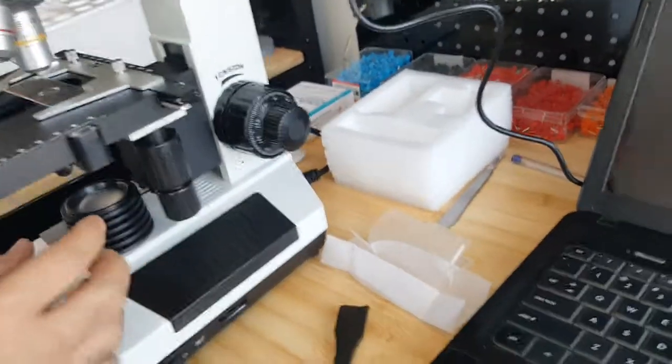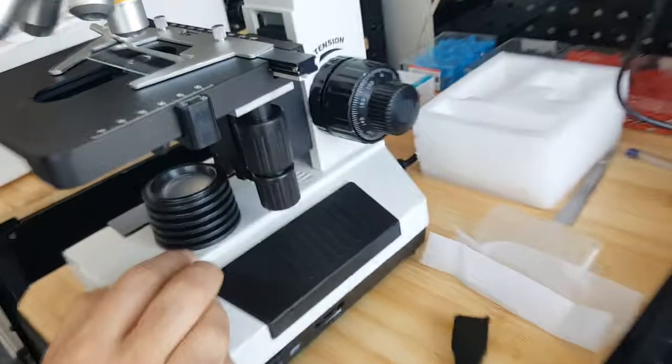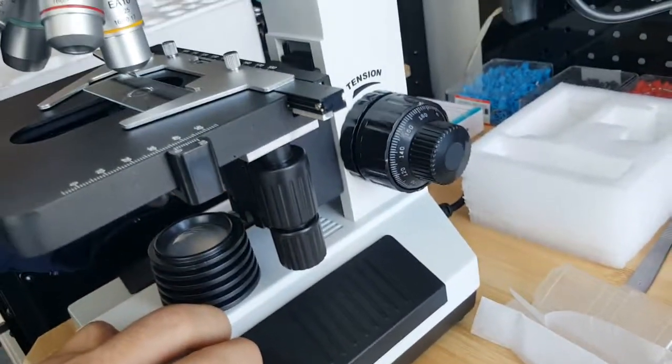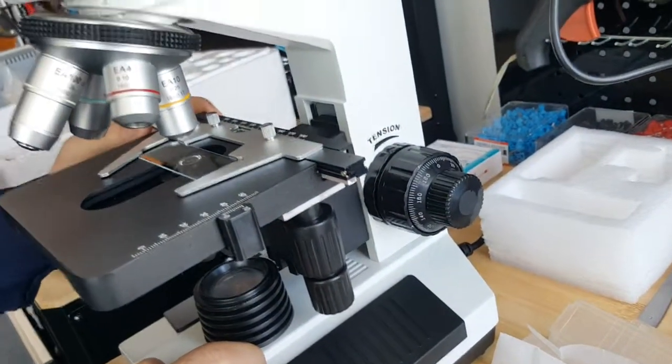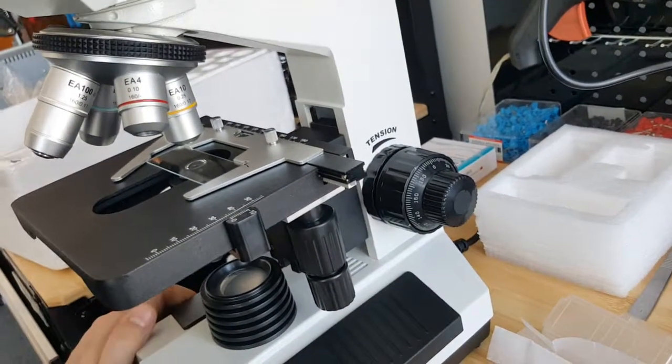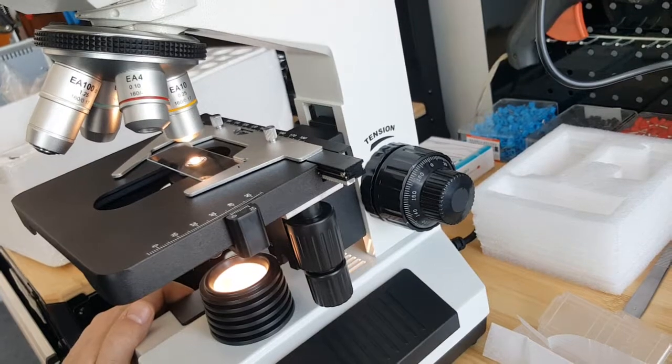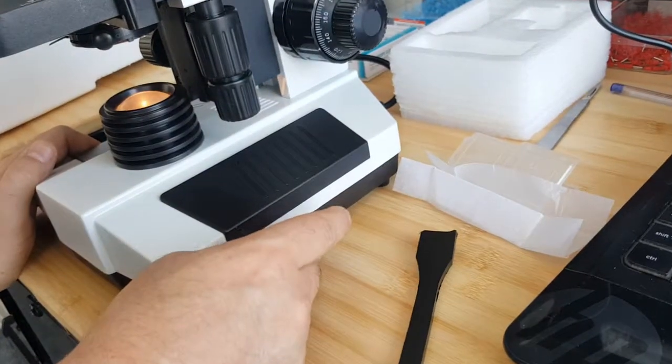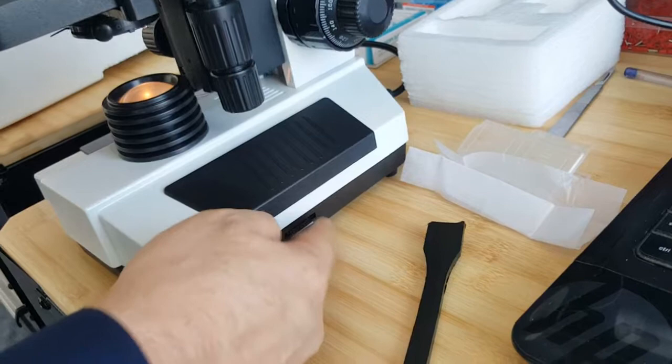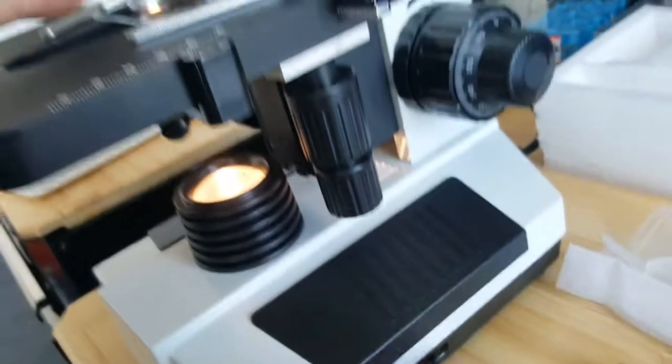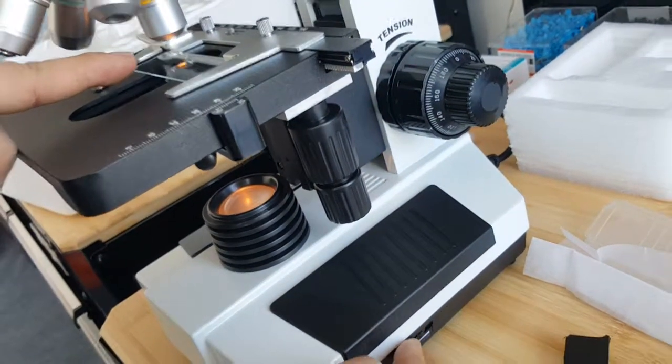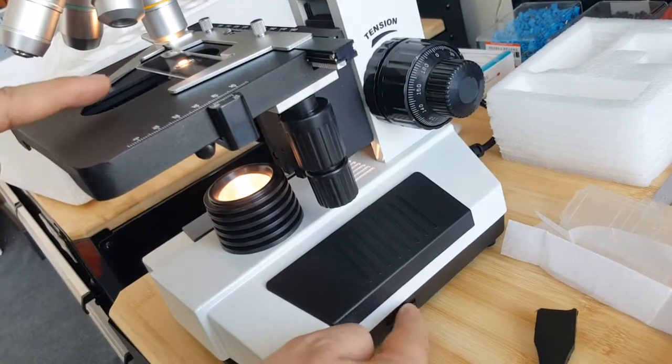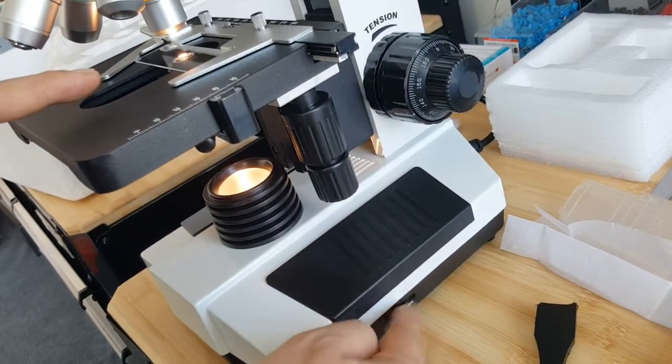And also here we have a grip. That's all. The lamp will be on by this key, and adjustment of the light value will be done via this wheel. You see the light value going down and raising as you turn this wheel in this direction.